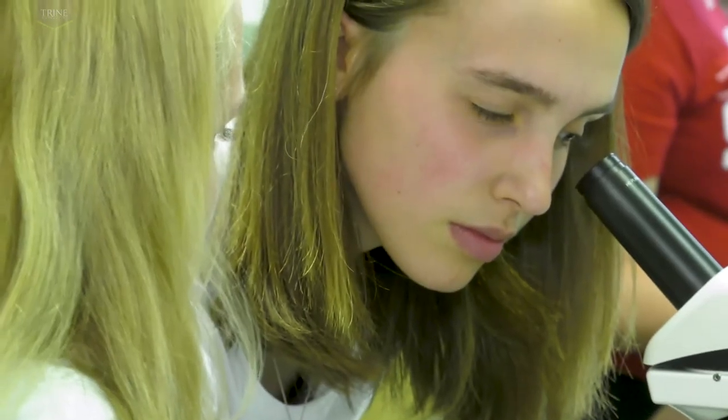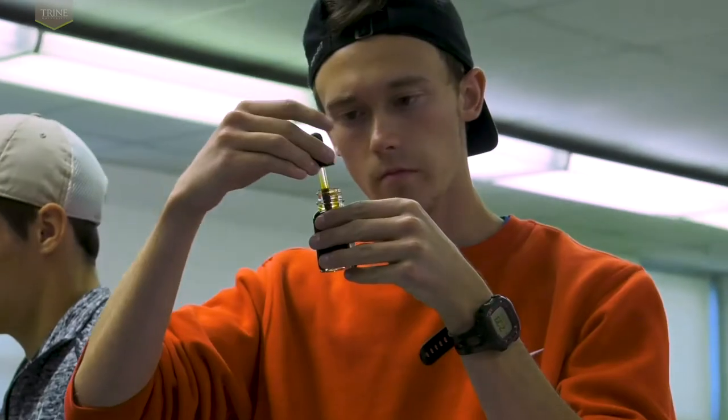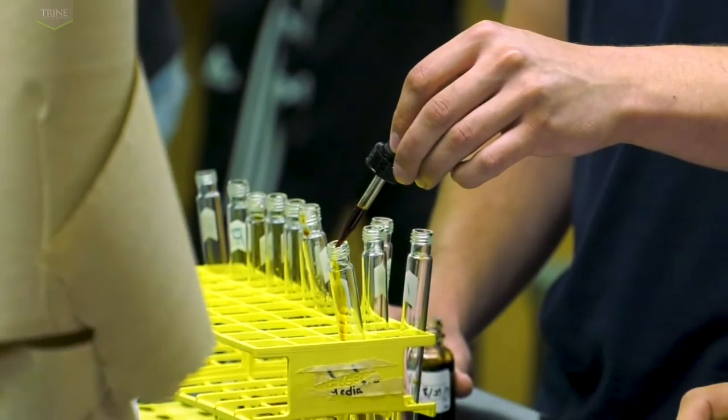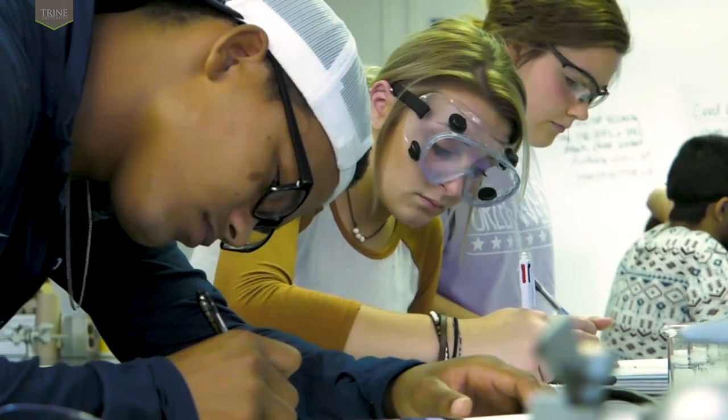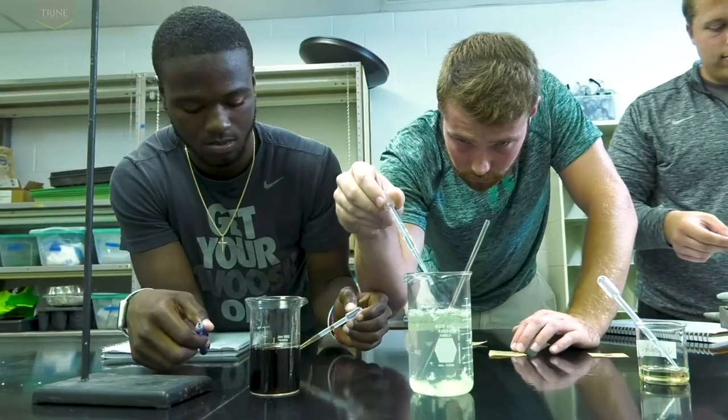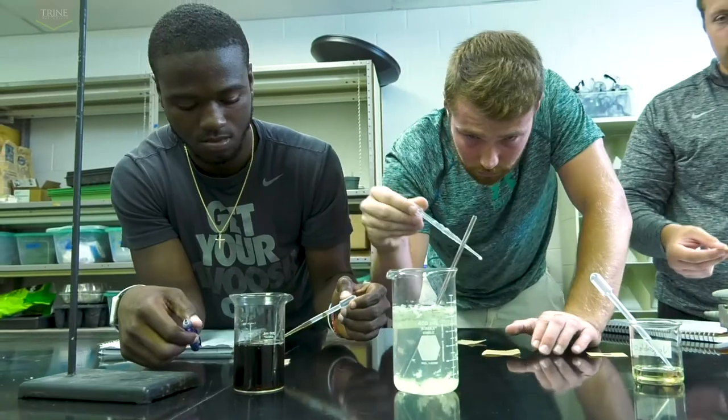The biology labs are meant for an exploratory experience for new students to learn the vast array of topics in this field of study. We hope to help students find an area that sparks their interest, which they can further pursue in upper-level courses.